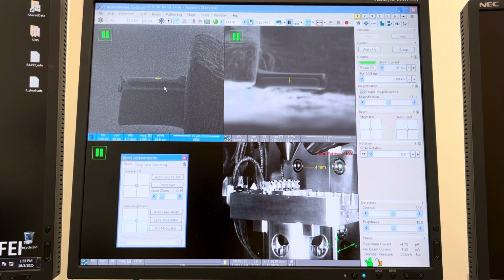Sometimes that's a sign that the pre-vacuum pump is failing and needs to be replaced. It depends on how frequently it happens, but I've seen this happen specifically on this system occasionally, and apparently it happened within the last day or so. So anyways, you're kind of between a rock and a hard place at this point, and really you just gotta wait.